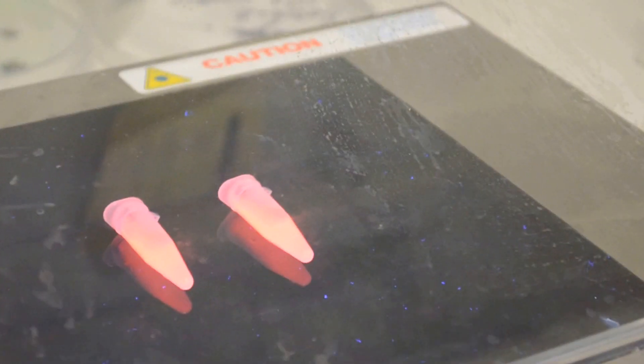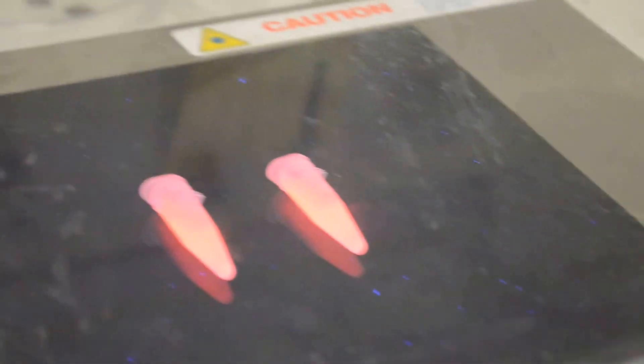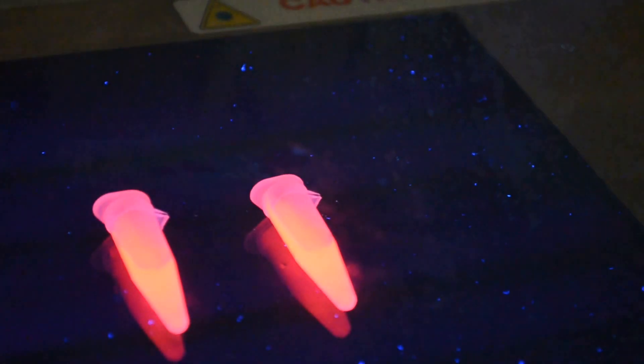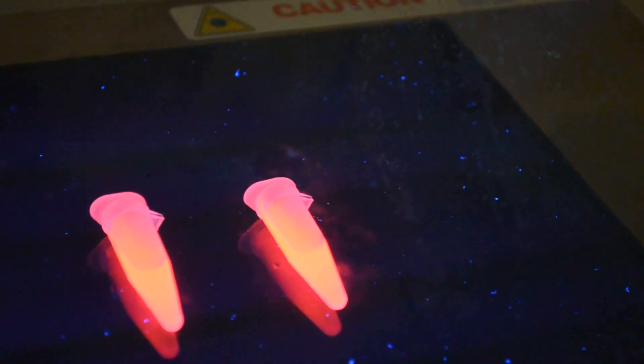Let's go to the UV light quickly because now is the time to see the quantum dots still remain in the suspension. You can see the quantum dots like this. This is how it looks in the beginning. It is fluorescent all over the tube.